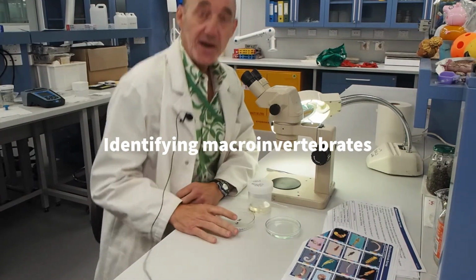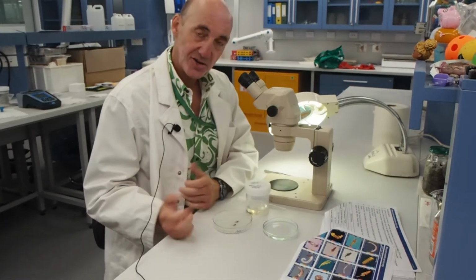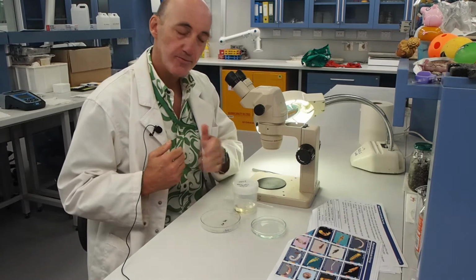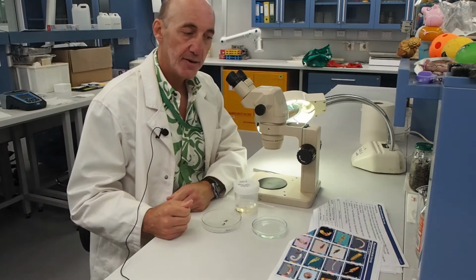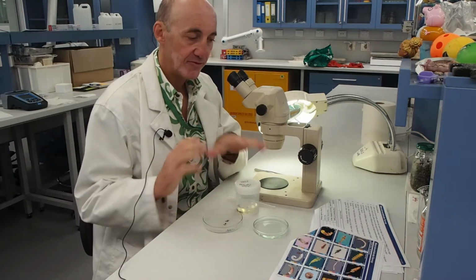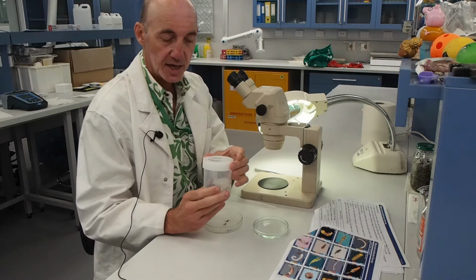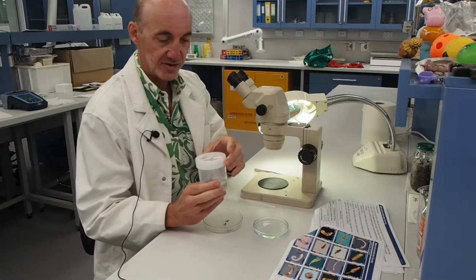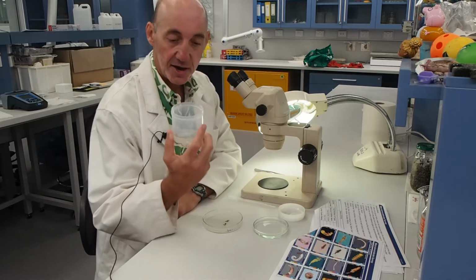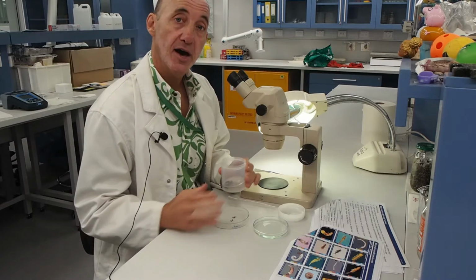Okay, so now I'm going to demonstrate how you would have processed your bugs, your macroinvertebrates that you got from the stream. Remember, we sampled a 10-metre stretch of the bank using the net, and then we did a 20-minute live pick where we collected anything that was moving or obvious. Then we put it in our jar with ethanol, and I'm not telling you the answer for the ethanol question, but what we got is our sample. So now we need to identify what we found.